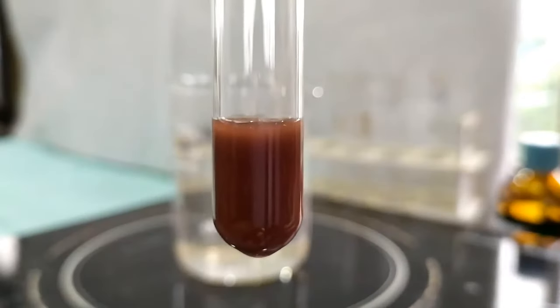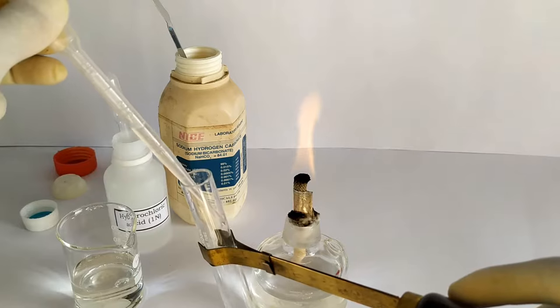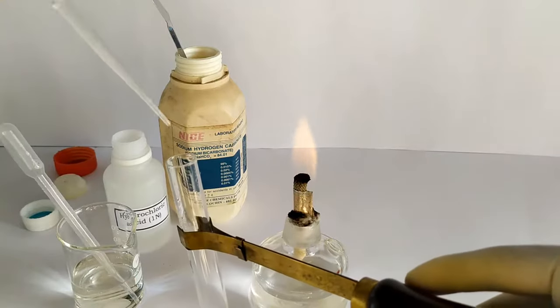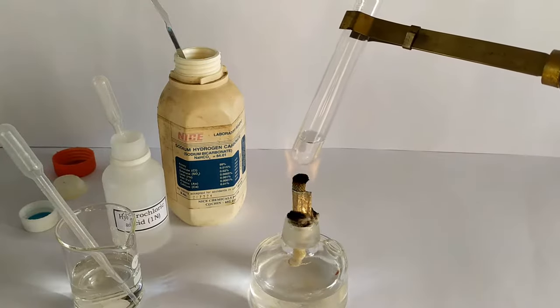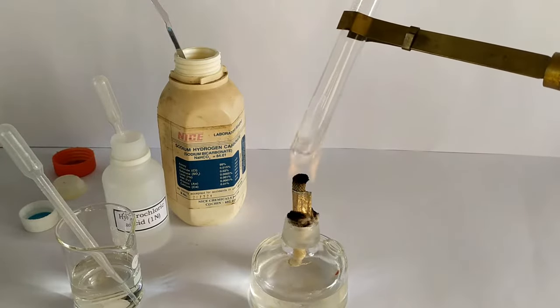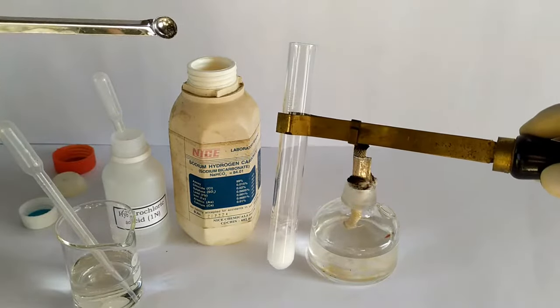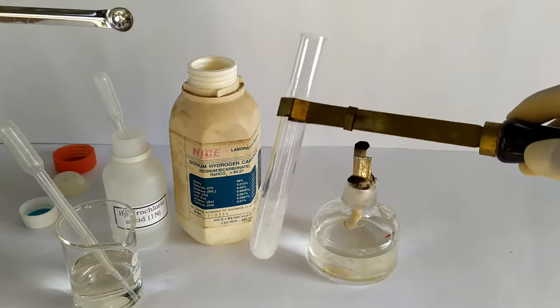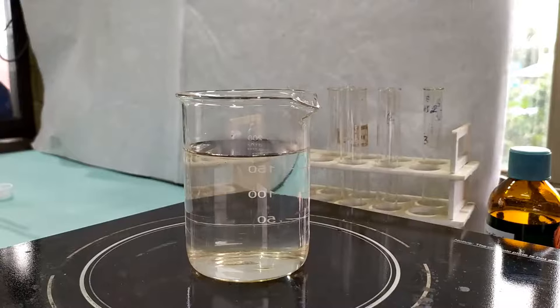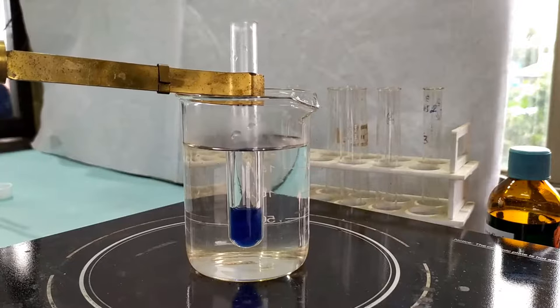Fehling's test can also be performed on samples suspected to contain non-reducing sugars such as sucrose. For this test, take 2 ml of the sample in a test tube and add 1 ml of dilute hydrochloric acid. Boil the contents for about a minute. Allow the test tube to cool down and add sodium carbonate or sodium bicarbonate to neutralize the residual acid. Neutralization is achieved when effervescence ceases. Fehling's test is then performed as usual on this hydrolyzed sample, which should now contain reducing monosaccharides.